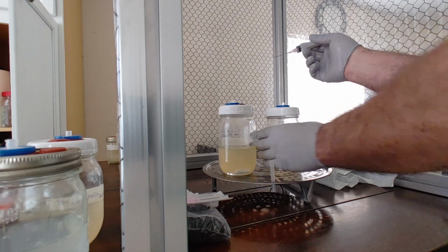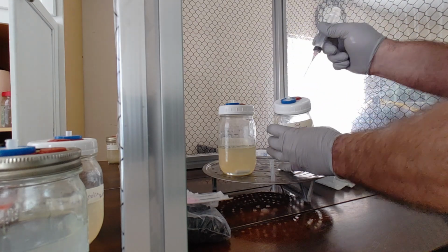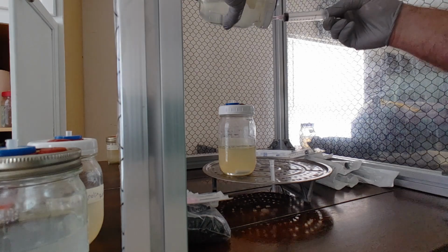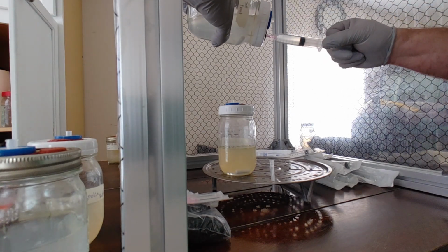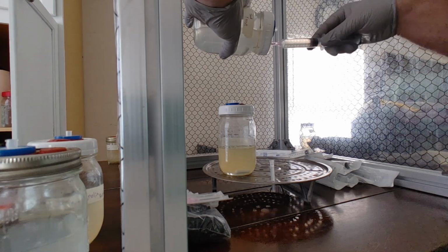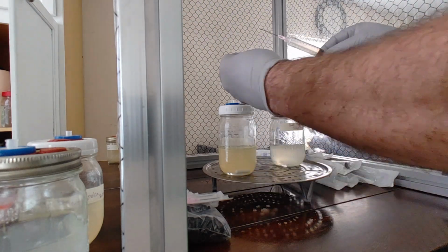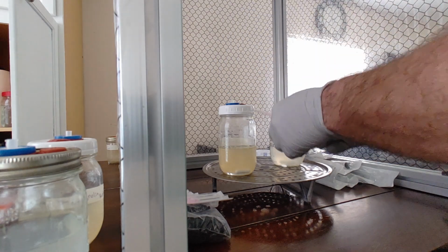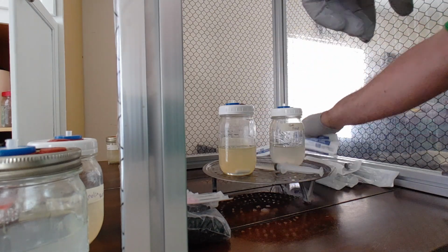The first one we're gonna do is Jack Frost. So we're gonna stick it right in the middle. We're gonna turn our jar to the side and draw. We're gonna draw until we get to 10, and that bad boy's full. We're gonna cap it. We're gonna go for the next one.